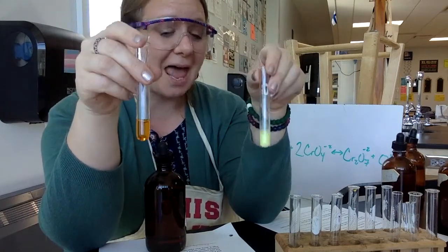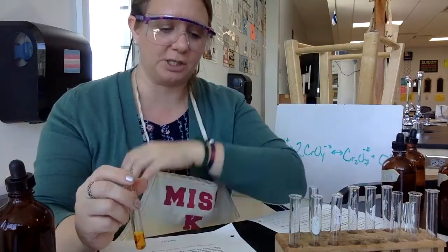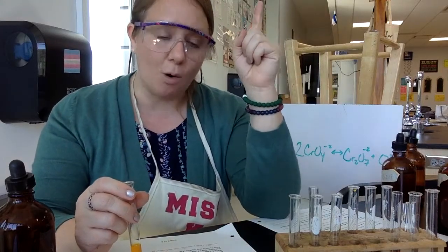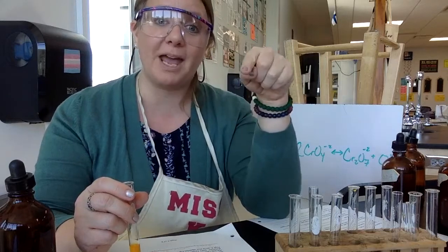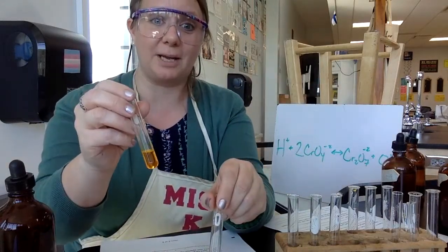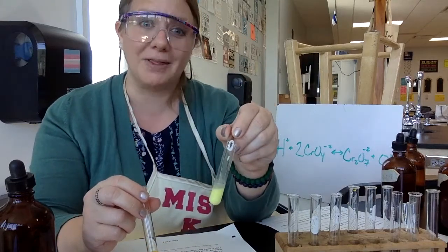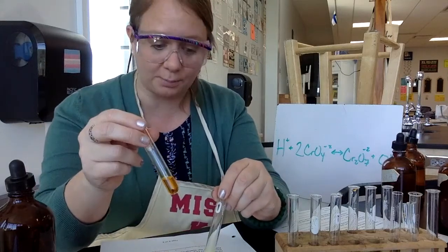So look at the next question to think about the chemistry of steps 6 and 7. Which is more soluble then, Ba with the chromate or Ba with the dichromate? Take a look, these are your options. This is what the dichromate barium looks like. This is what the chromate barium looks like. Then it's really easy to tell. This is definitely more soluble because we did not see a precipitate.